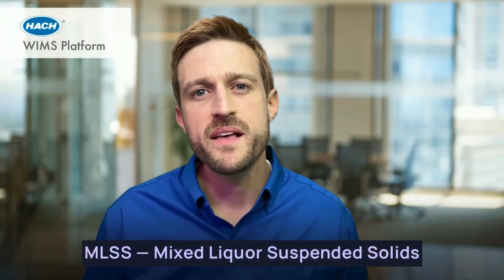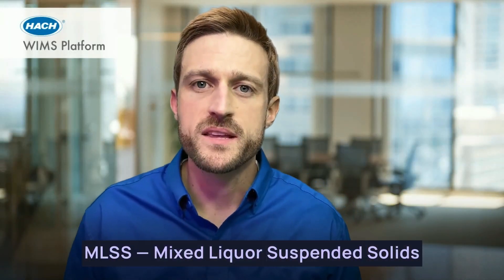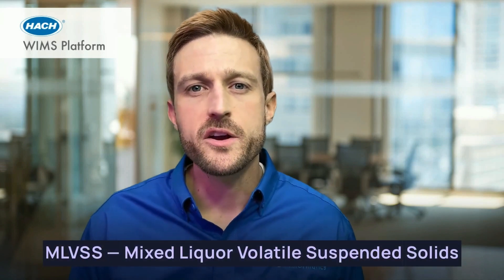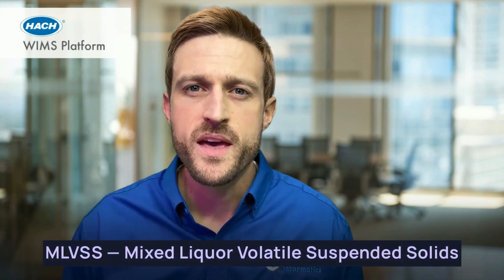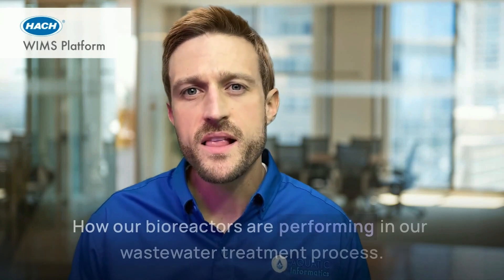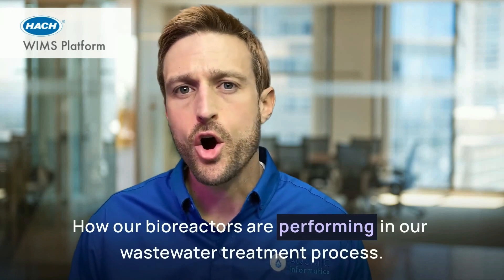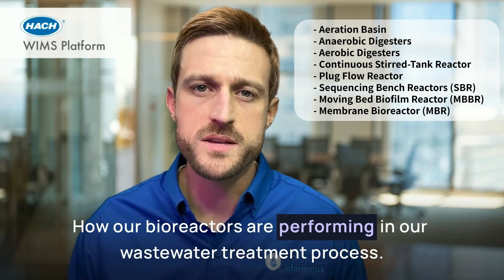Today we're going to talk about MLSS, Mixed Liquor Suspended Solids, and MLVSS, Mixed Liquor Volatile Suspended Solids, and what these numbers together can tell us about how our bioreactors are performing in our wastewater treatment process.